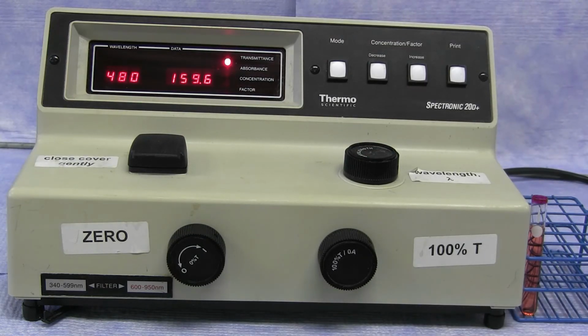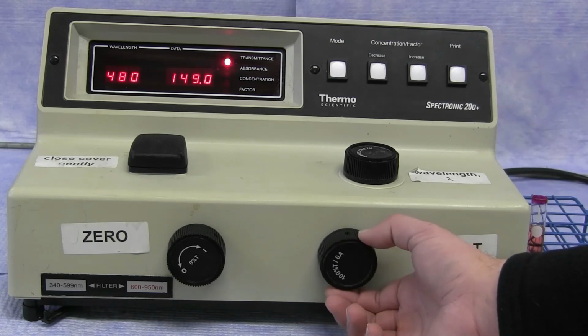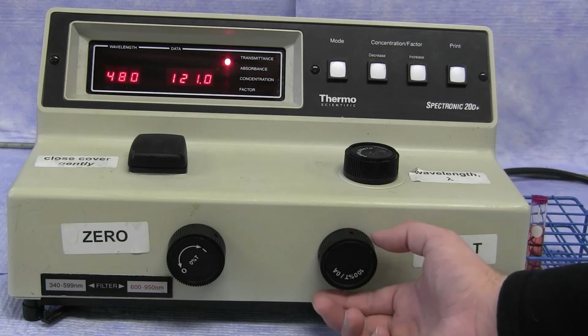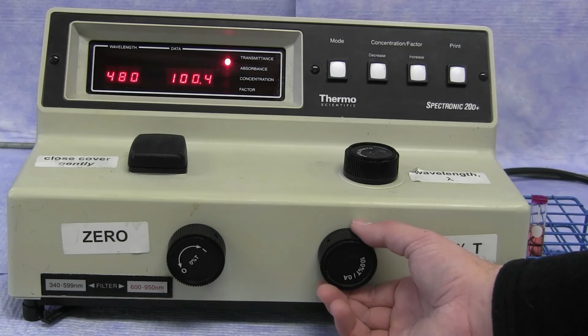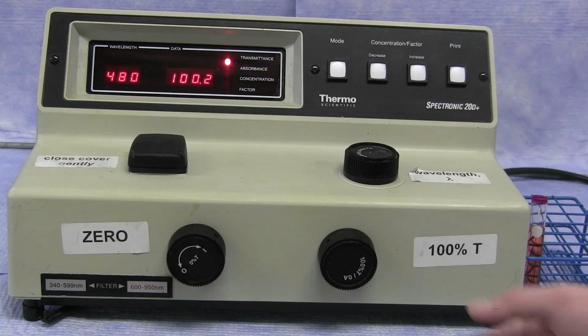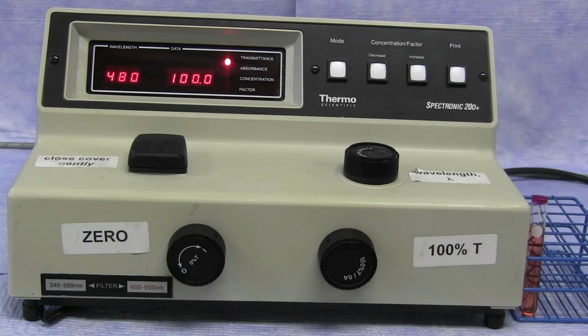With the cuvette containing your solvent inside the spectrophotometer, you can now use the right control knob and adjust this to 100% transmittance. This is a 2-point calibration where it tells the instrument when the light is off and there is no sample, there should be 0% of the light getting through to the other side. Likewise, when you put in your solvent, you want it to read 100% because at this point, you're only interested in the absorbance of your sample, not the solvent.